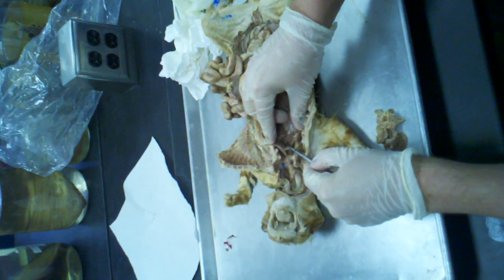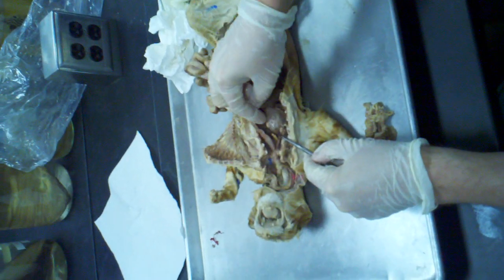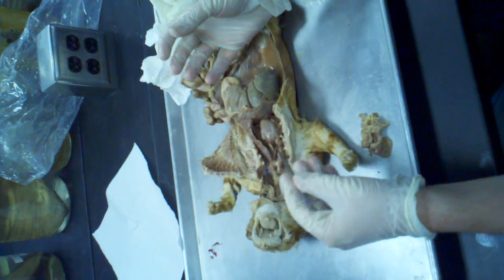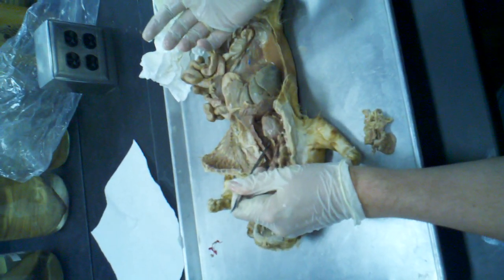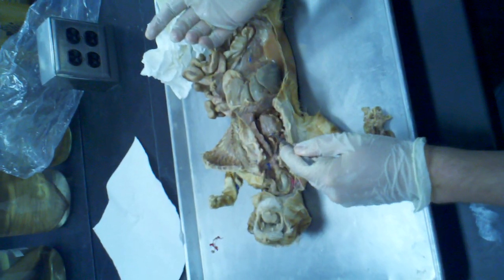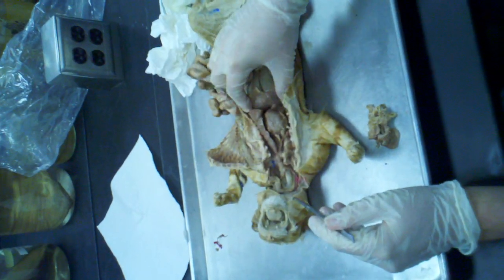There's a very small atrium on one side, another one on the other side, and then the ventricles on each side are really tough and much longer, right? So if I want to pin the atrium, I have to pin it right on the top here, and I would have to do it on a cat where the pericardial cavity or sac has been removed. Okay? And of course here's the diaphragm.